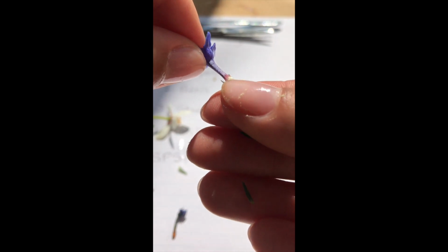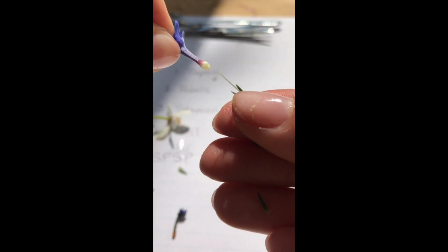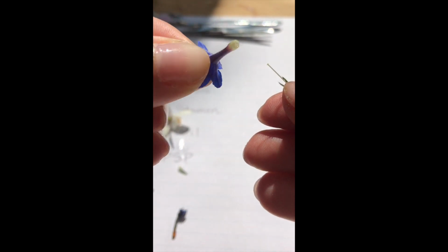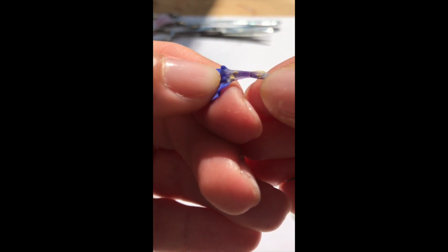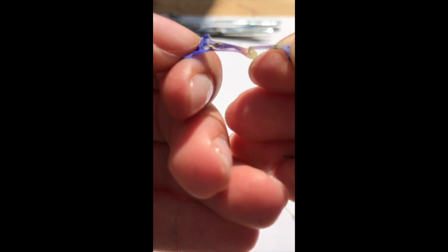So the petals that come off are actually this whole purple tube. I just slid it off. When I slid it off, I don't want to just throw it away because I want to look back. I don't know if you can see super well, but do you see those little yellow fuzzy looking parts? Yellow and fuzzy almost always means pollen. So that's the pollen at the top of the stamen. That's our next flower part.